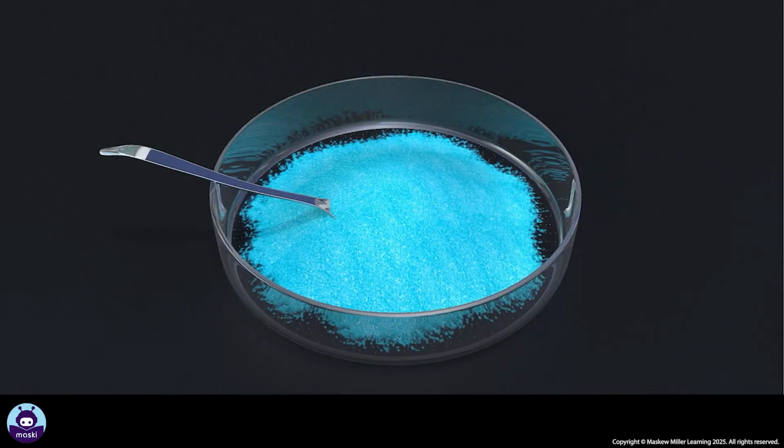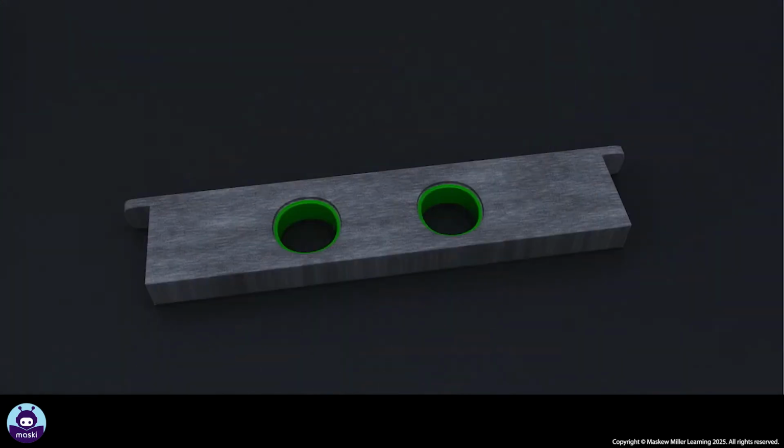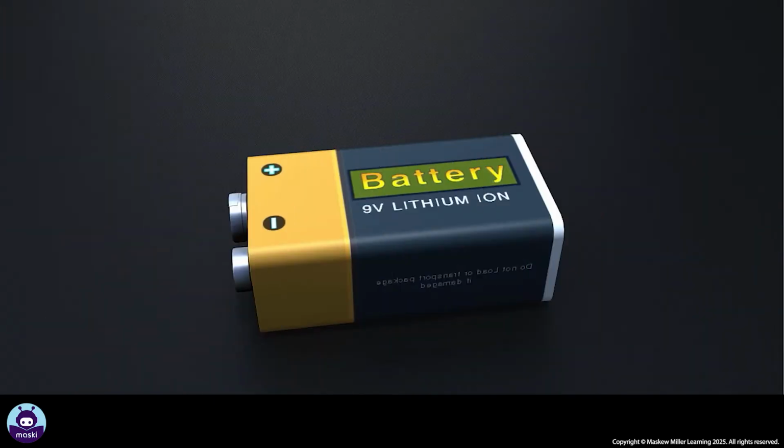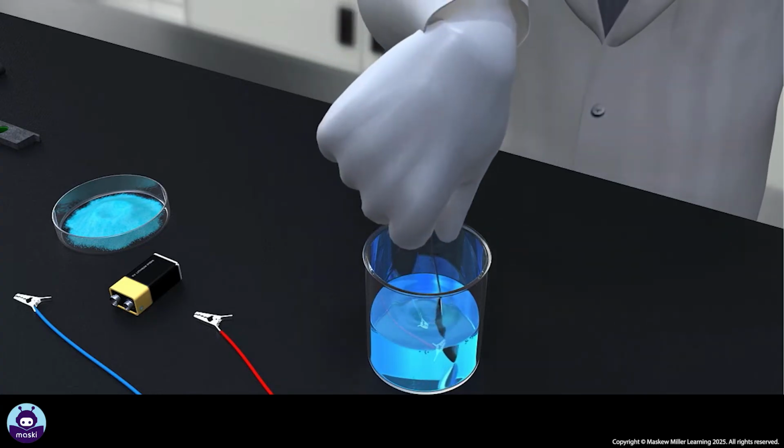You need 2 teaspoons of copper chloride crystals, water, a beaker, graphite rods, a holder for the rods, conducting wires with clips, a 9 volts battery. Dissolve the copper chloride crystals in about 200 milliliters of water in a beaker.